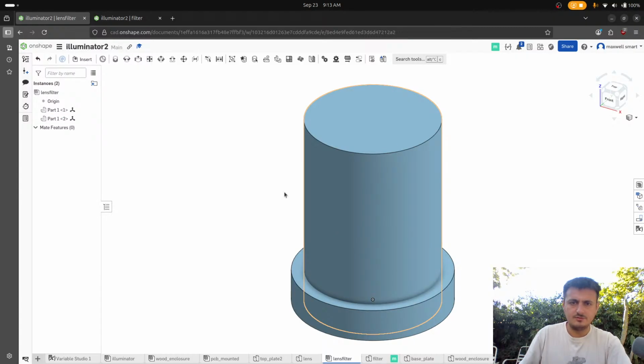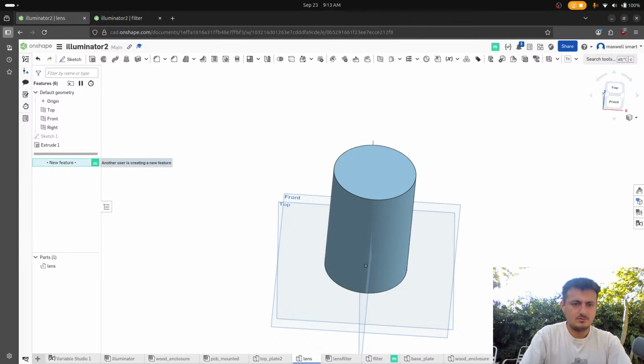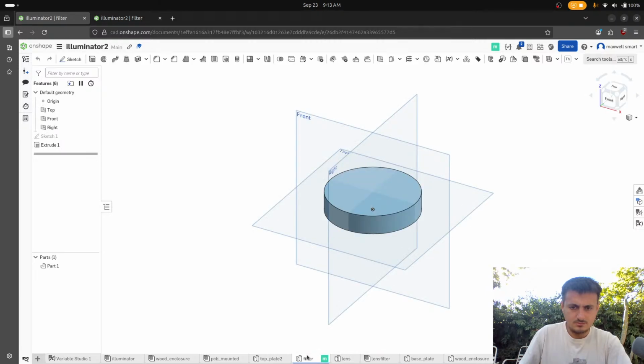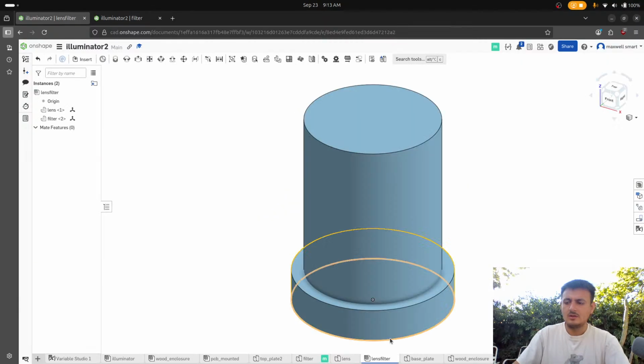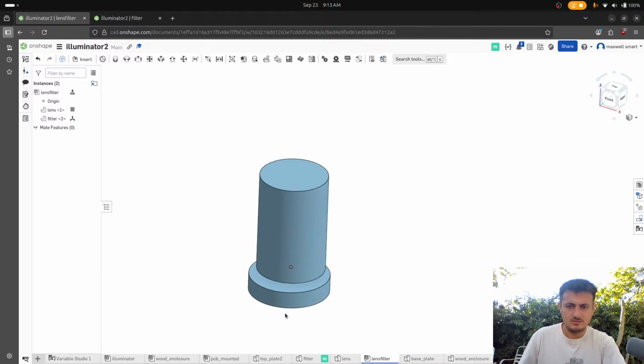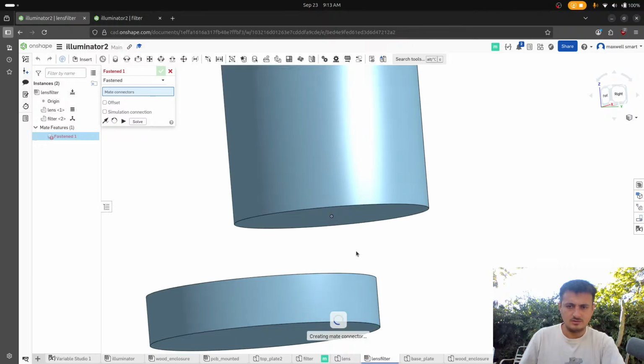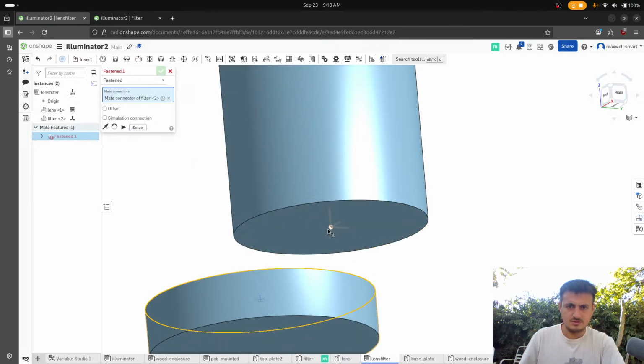Okay, so what we want to do is we're going to fix. So wait, let's rename these things. So this is going to be filter. Okay, so now what we want to do is we want to fix the lens. And then we want to mate this to here.